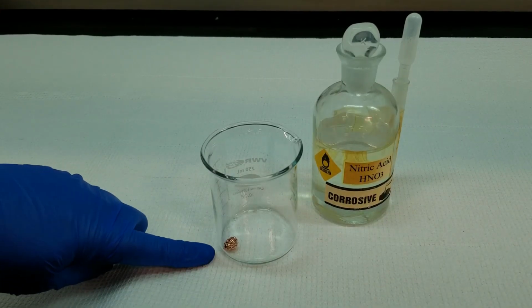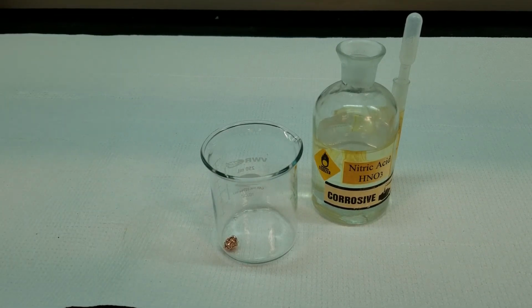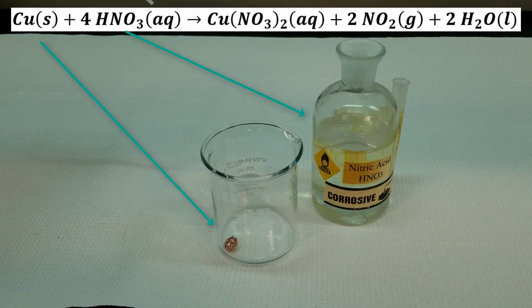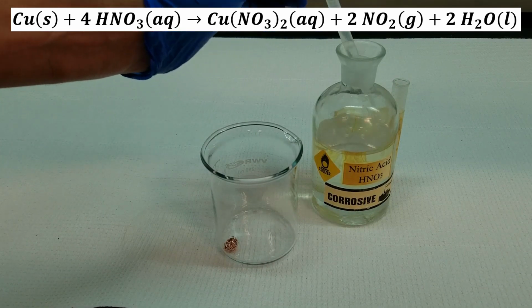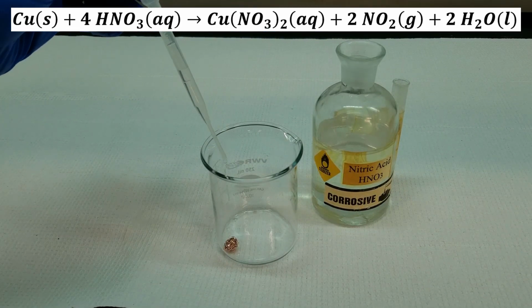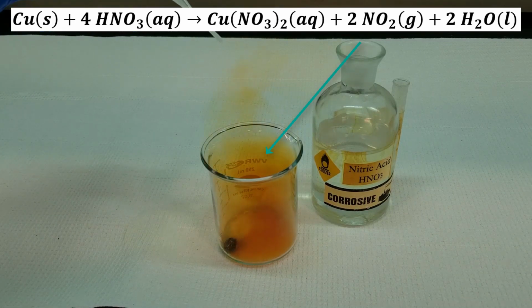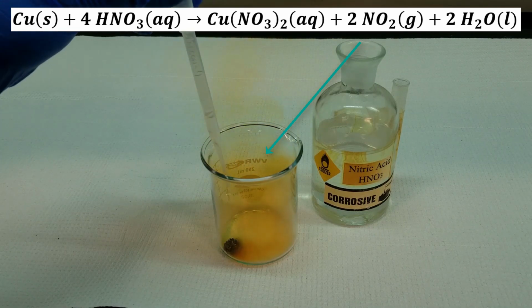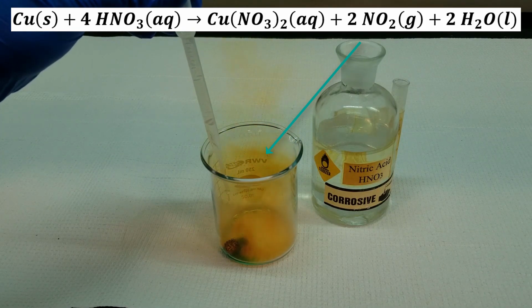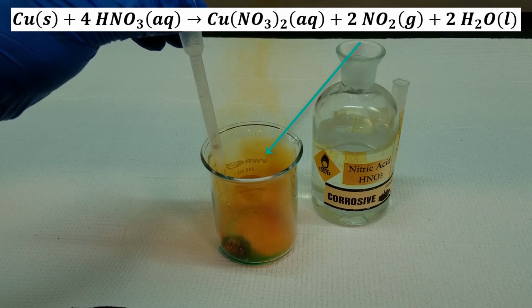Okay, here's our copper metal, all wrapped up as a little ball, and here's the concentrated nitric acid. Copper doesn't react with most acids, but boy does it react with nitric acid, as you can see. So we just add the nitric acid drop by drop until that copper metal is gone.